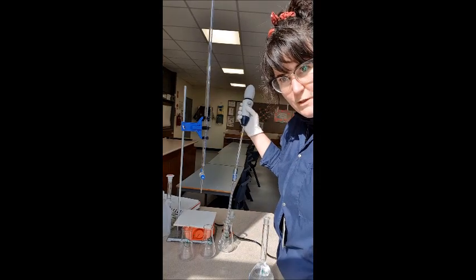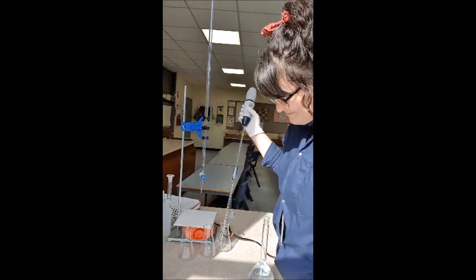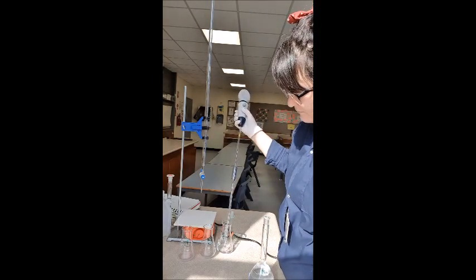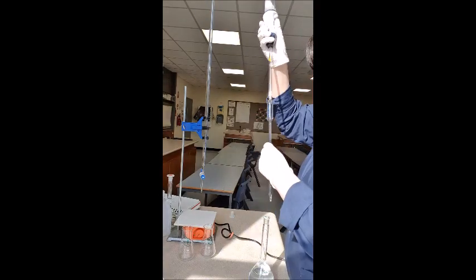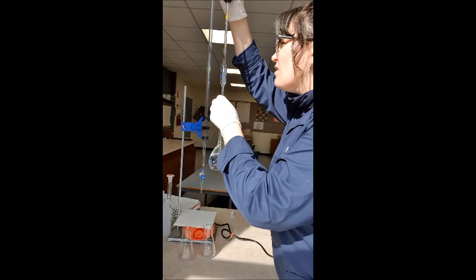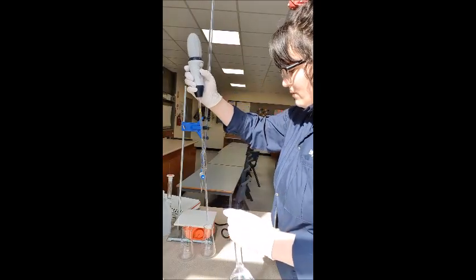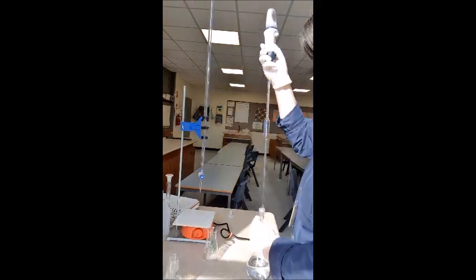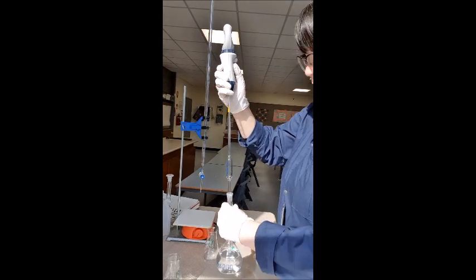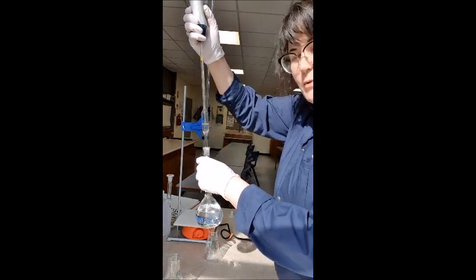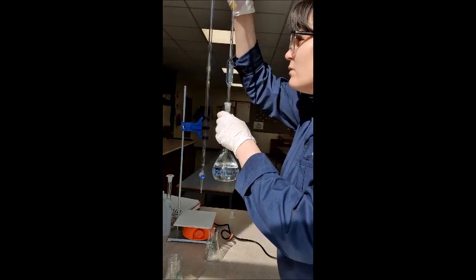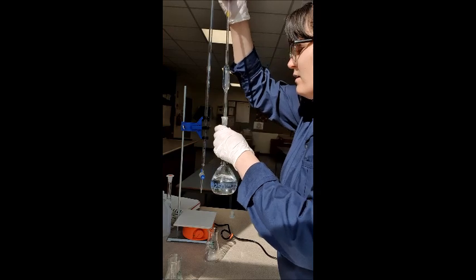I used to do a lot of titrations for work. I actually love them. It's so satisfying when you get important results. That's two. Third flask. And final. So I'm just pipetting all these out so I don't have to do it in between each one. I might need to do more than four if I don't get concordant results. But we'll see.